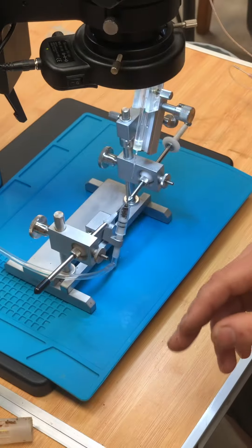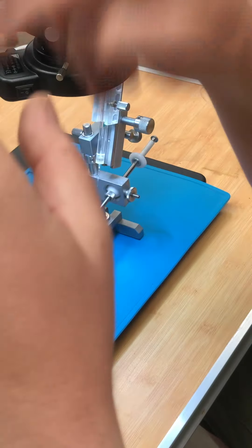And that's the sting there? That black bit — it's actually curling up towards us, even though it looks like it's curving down. That's why you shouldn't do instrumental insemination on a screen, because you can't tell whether something's facing up or down or where.